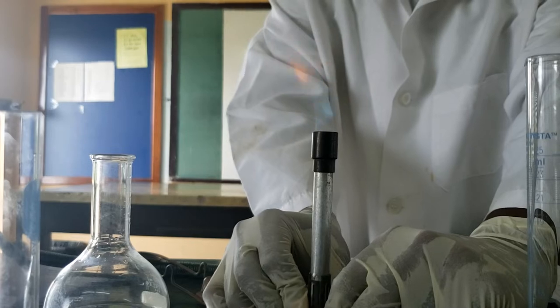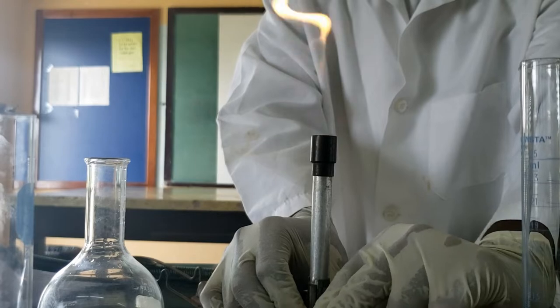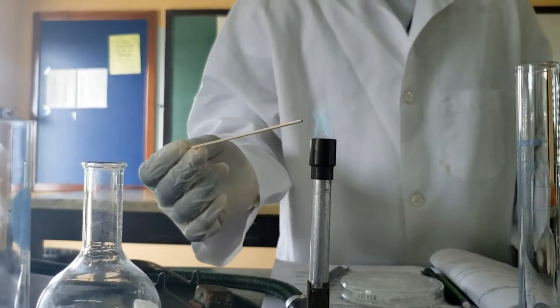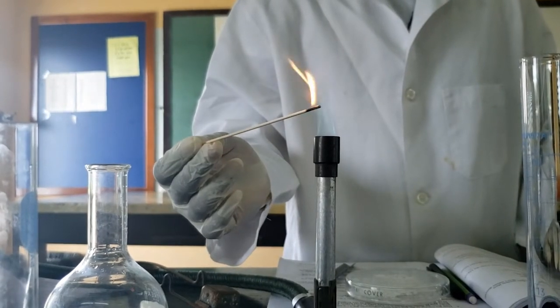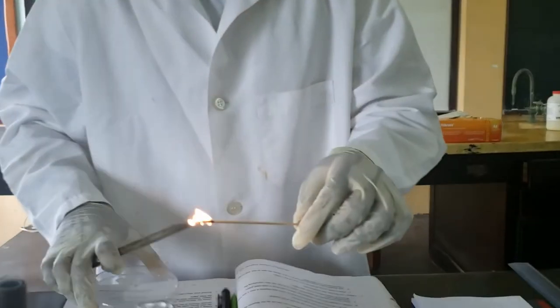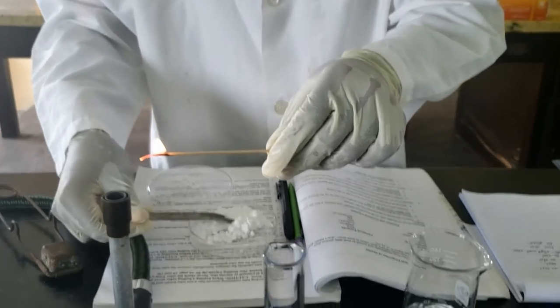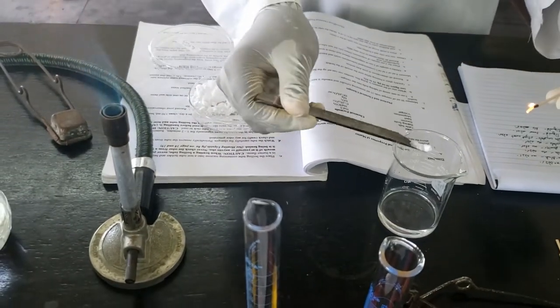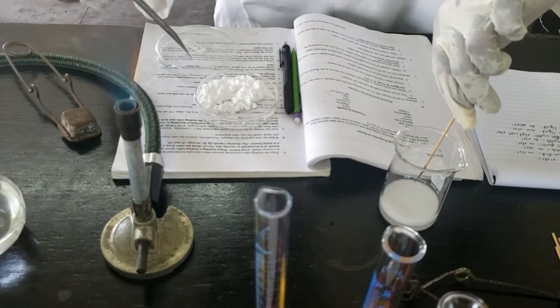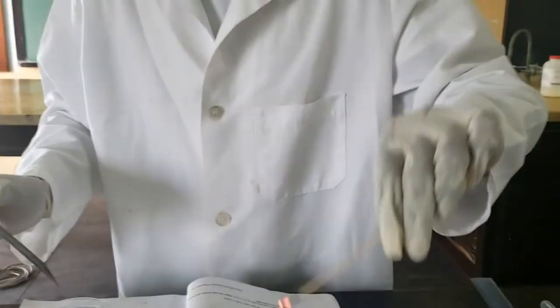We adjust the flame — first you lower the flame, then you open the oxygen intake. We have a burning splint — see it's still on fire. We get our scoop of baking soda; it doesn't require a lot. And as soon as you add that, you want to put the flame inside. And what do you observe? Notice the splint — it goes out.